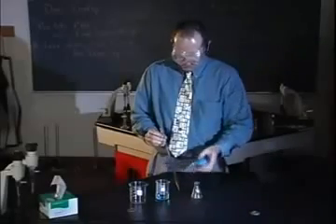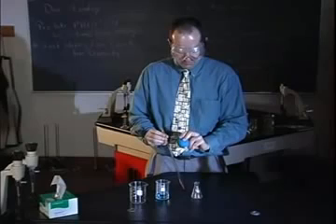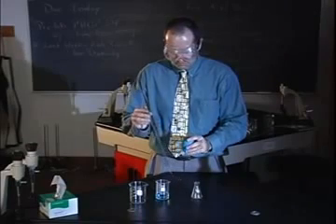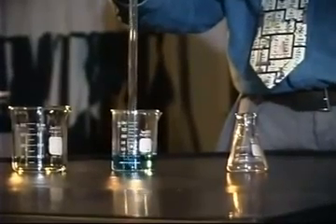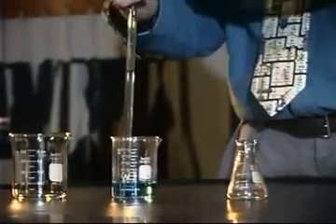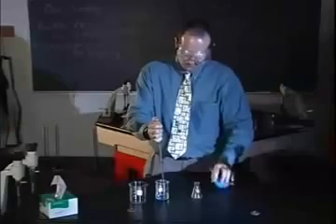The second type of bulb is a simple rubber bulb. Squeeze the bulb to evacuate the air and allow the bulb to expand to draw liquid up into the pipette. Draw liquid past the desired line, then quickly replace the bulb with your finger. If liquid drains from the pipette, try wetting your finger with distilled water to improve the seal. Follow the same procedure described previously.